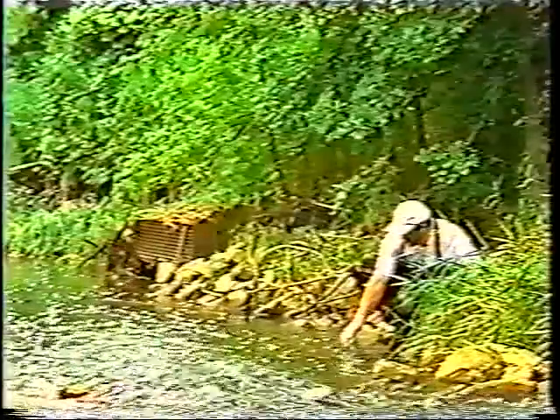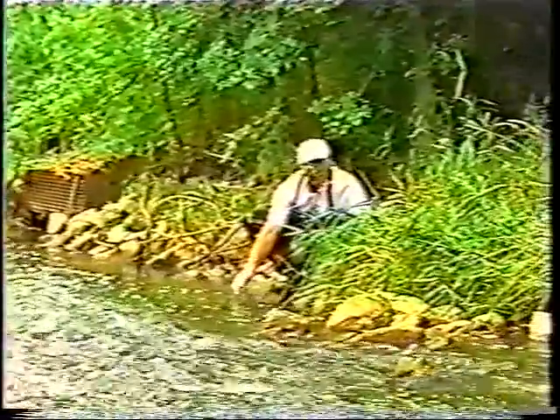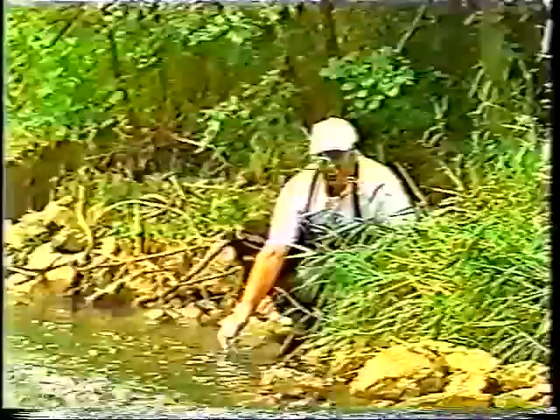Give it a chance to adjust and stabilize. And once you see that reading is stabilized, you can go ahead and collect the data and give that to your lab partner who should be standing nearby with their journal in order to write it down. In this particular case, the pH reads 7.2. So I tell my lab partner 7.2.